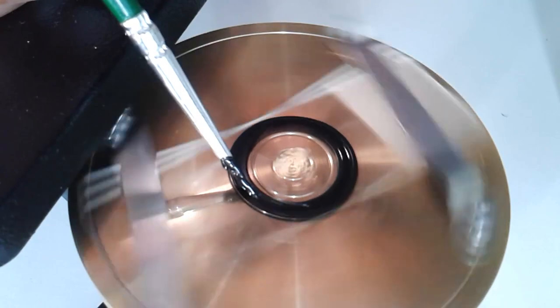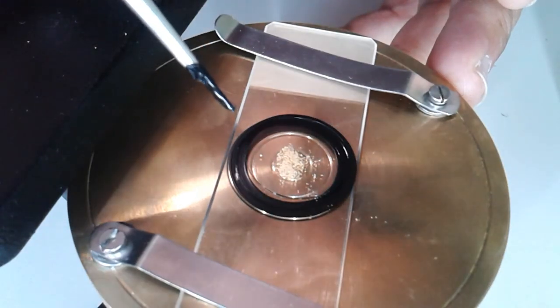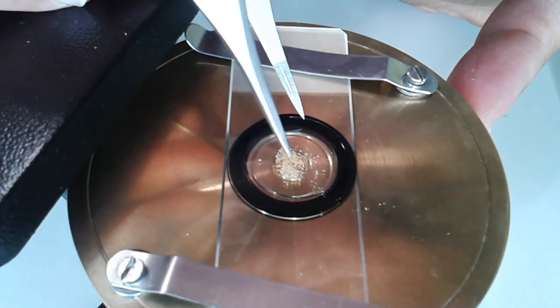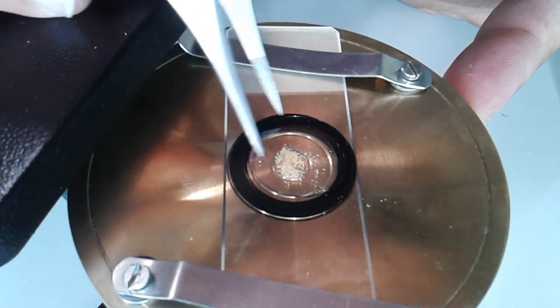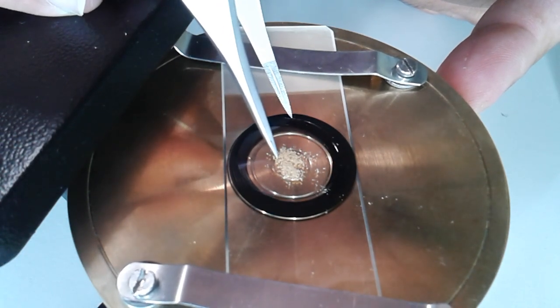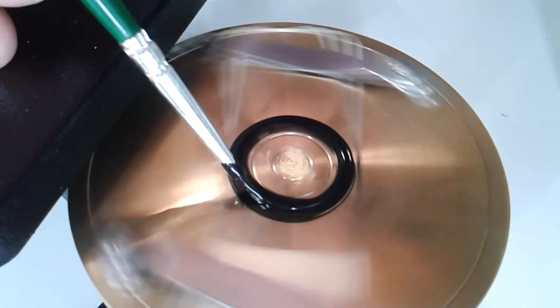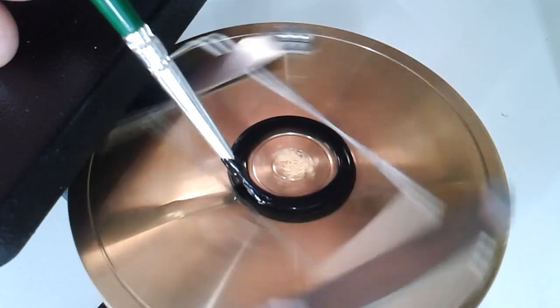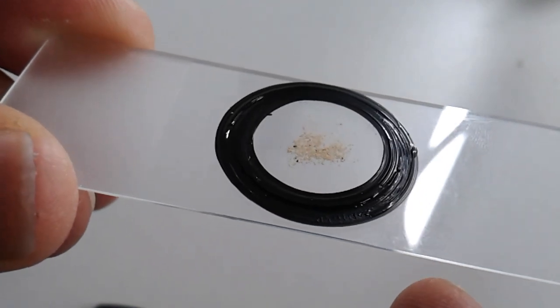Now I'm trying to seal everything by applying over the cover glass and the ring some more paint. I kind of hope that this way the cover glass will be solidly connected. Unfortunately, I moved the cover glass, so I have to use my general purpose tweezers to recenter the cover glass. I was a little bit too careless, but it's easy—you can center it quite easily. Then I applied some paint to seal the cover glass off, and this is how it looks like.